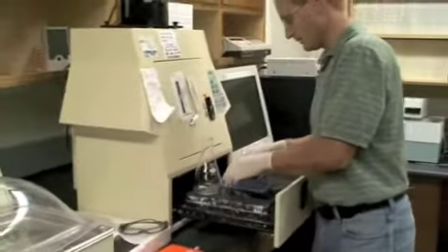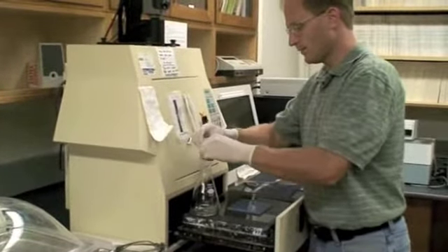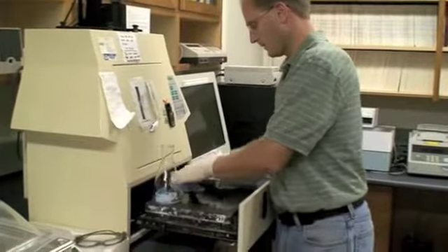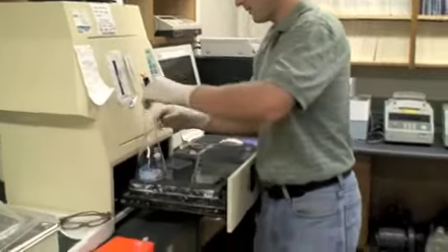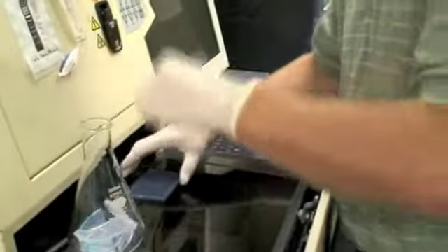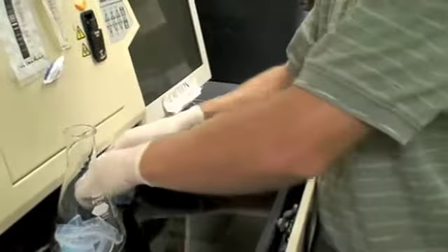I already cleaned up, not on tape, but I already put the gel tray, rinsed it off, put it up on the drying rack. So now I'm just breaking this up into strips, throwing it in there. It bends quite a bit before it breaks. It's kind of a weird feeling.